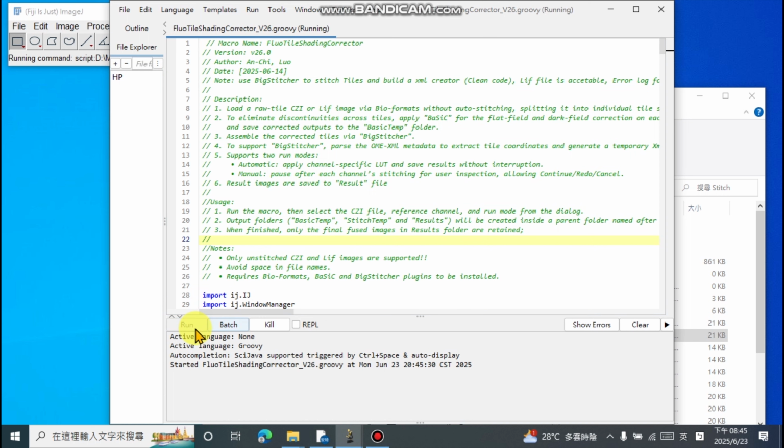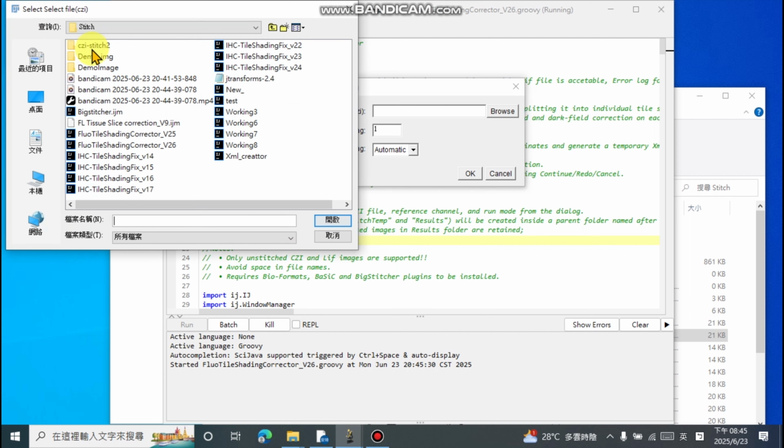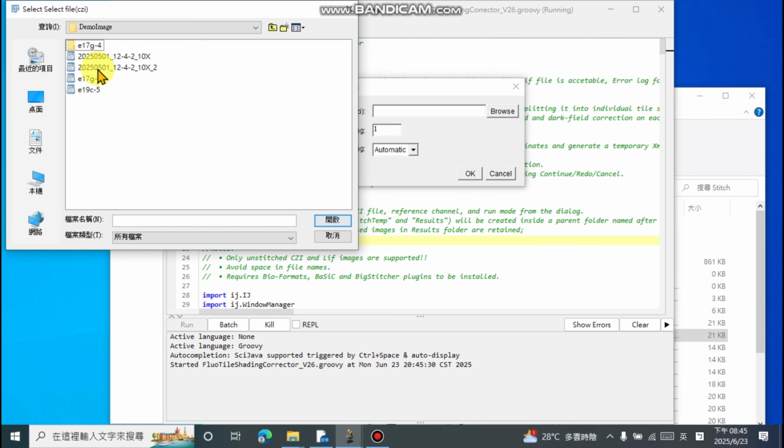After clicking Run, the tool will display the first dialog box. Below in this window, we need to set all the parameters for the subsequent execution of the program. The first setting is the location of the original file. After clicking the Browse button, select the original image from the folder. The tool supports two file formats, CZI and LIF. Note that the file path cannot contain any spaces.